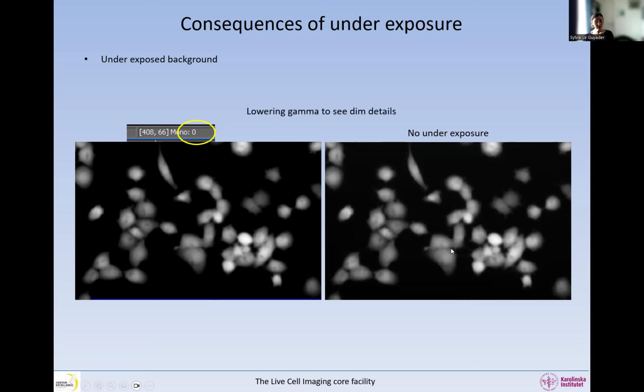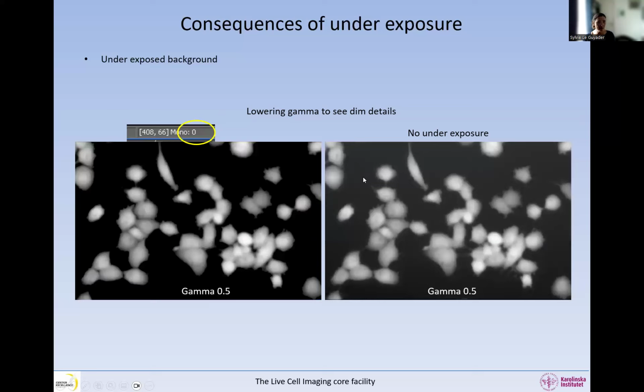But if I put the saturation and underexposure lookup table here, you will not get any blue at all. So now what I do is that I change the gamma to be able to see the very dim details in these two images. And so I put the gamma at the same place. And what happens, it's maybe a little bit difficult to see on the screen, but if you could look at the PDF, you will see there's a lot of details in this image that we couldn't see before without moving the gamma. All the fine filopodia and everything are there in the image. They are recorded in this image, but not in this one. But we just couldn't see it.